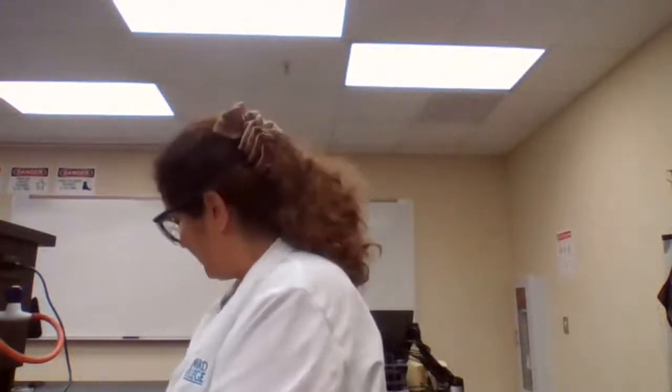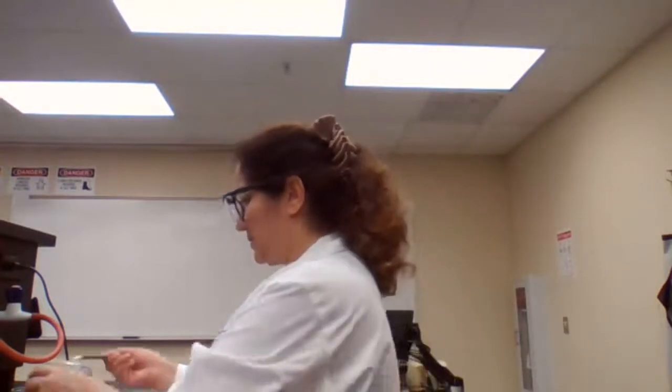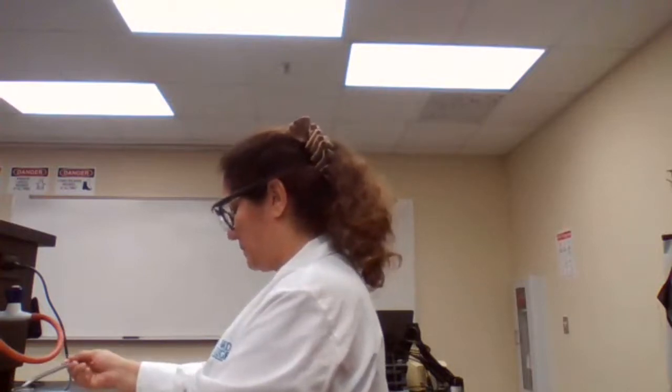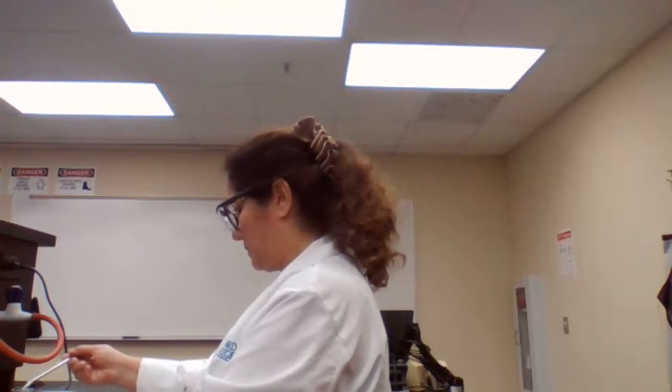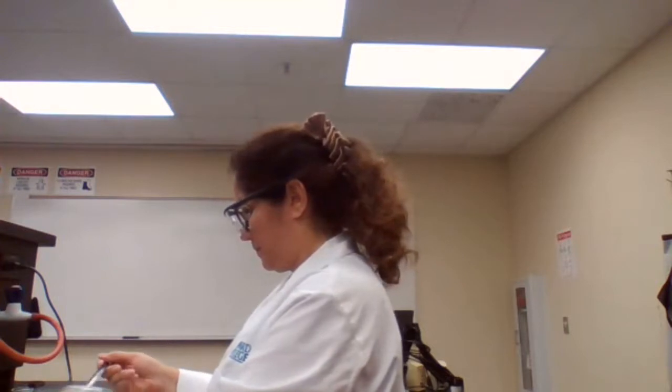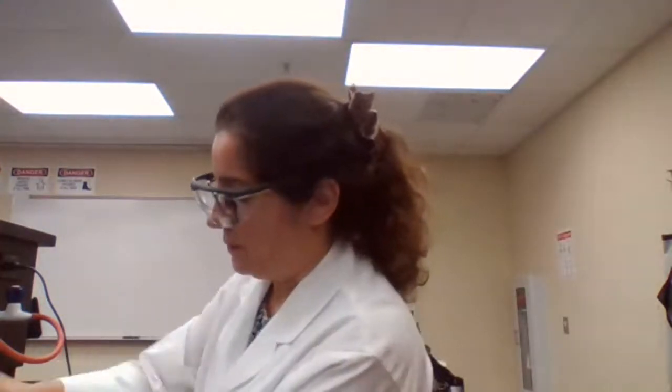Then we are going to add about 0.7 grams of KHP, so it would be about 130.6.